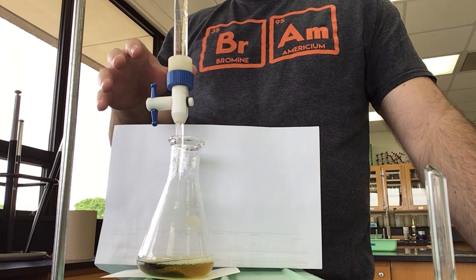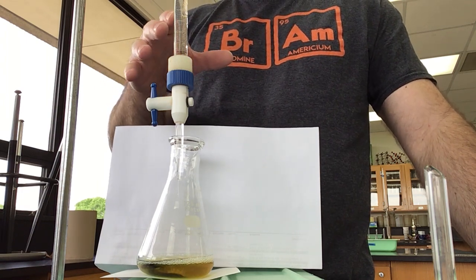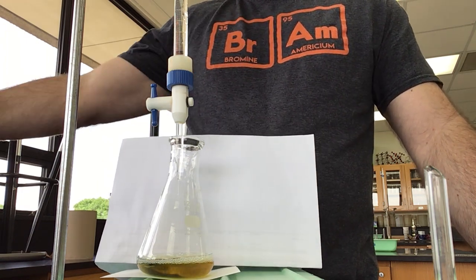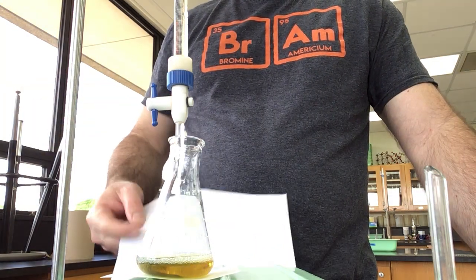You could also do this in a similar way to when we filled this—you could have the tip of the burette in the sink and let it drain.